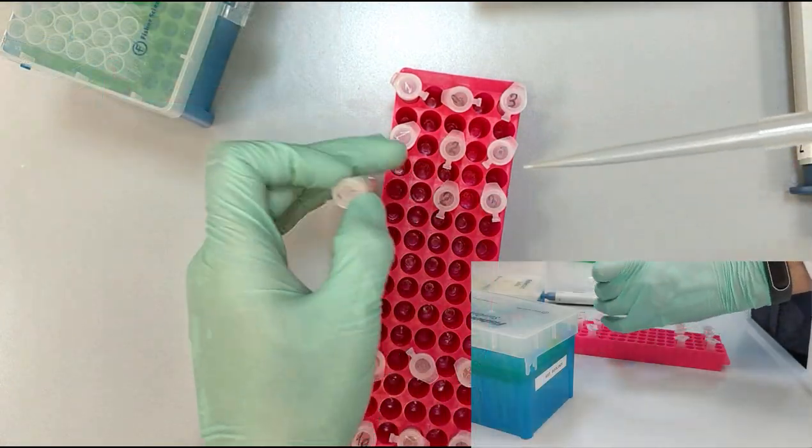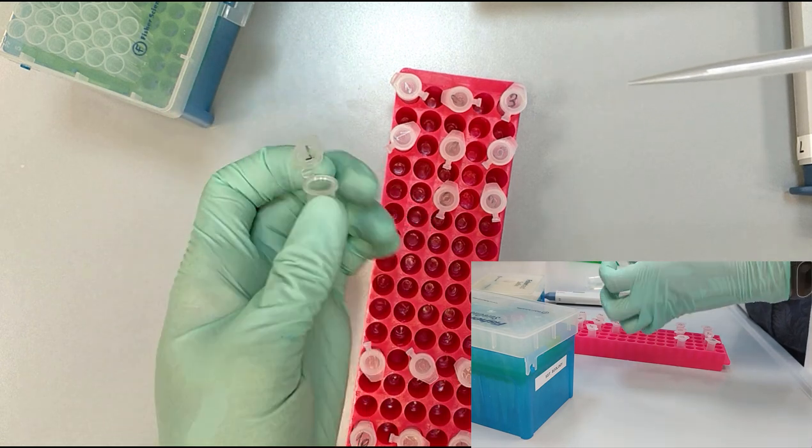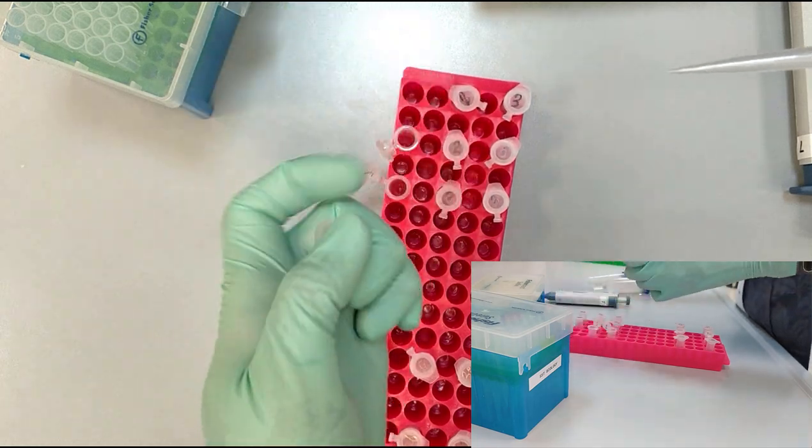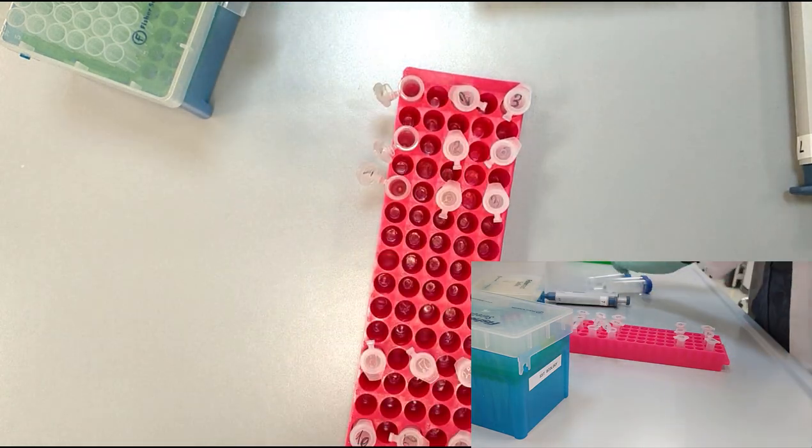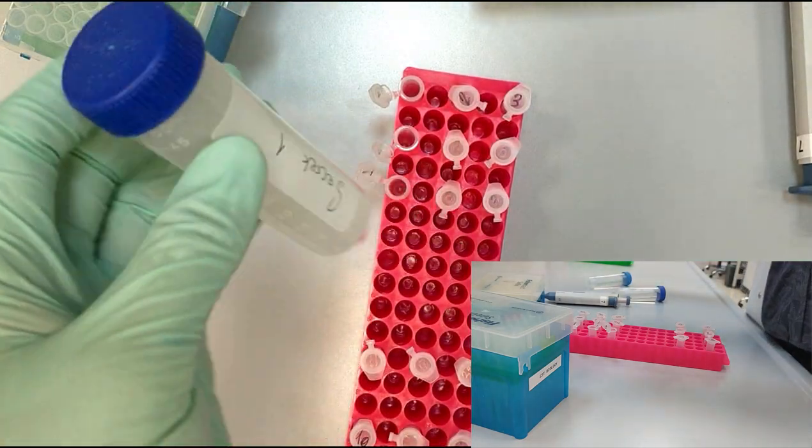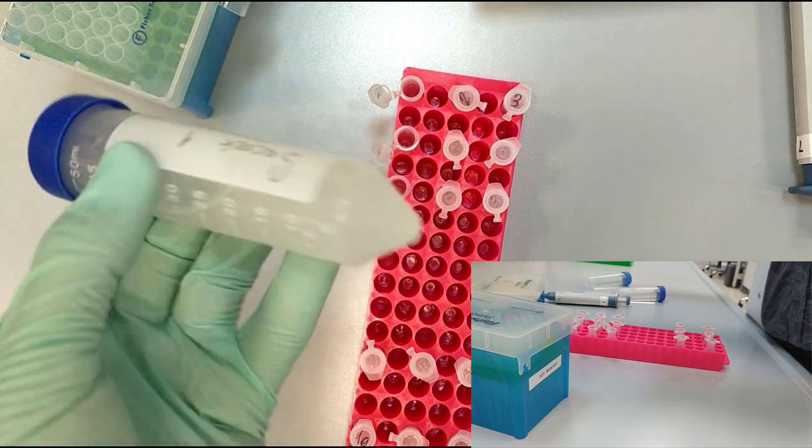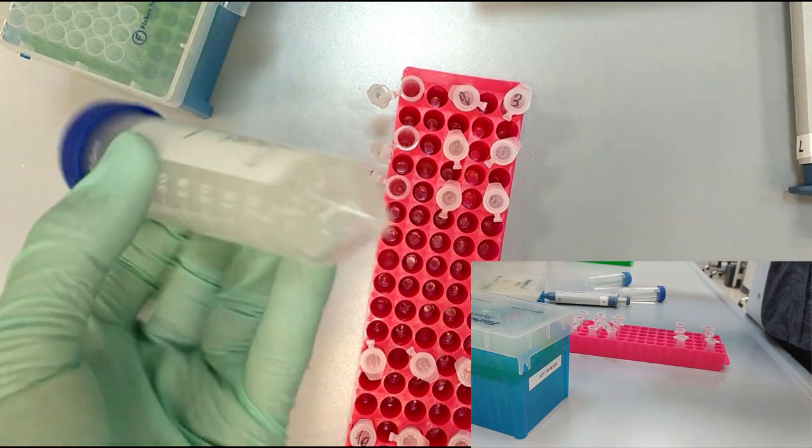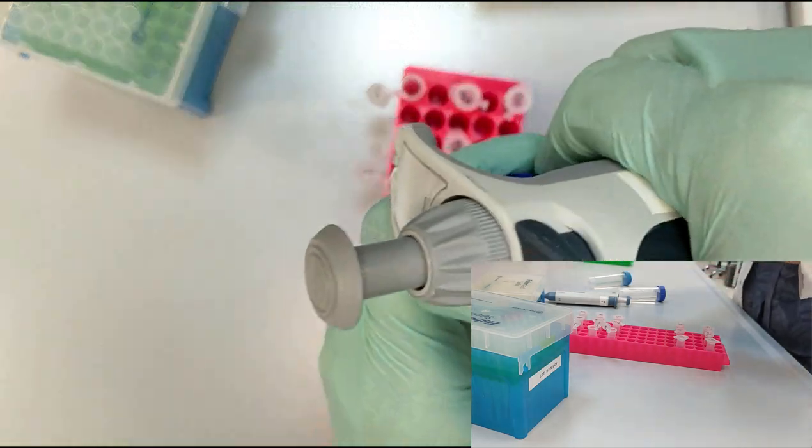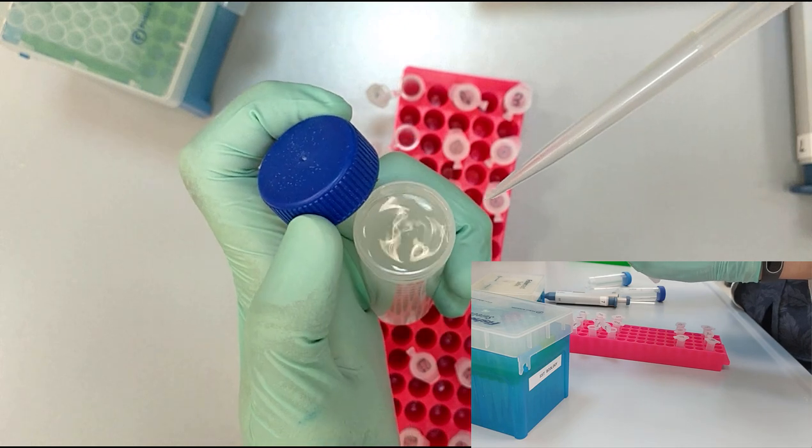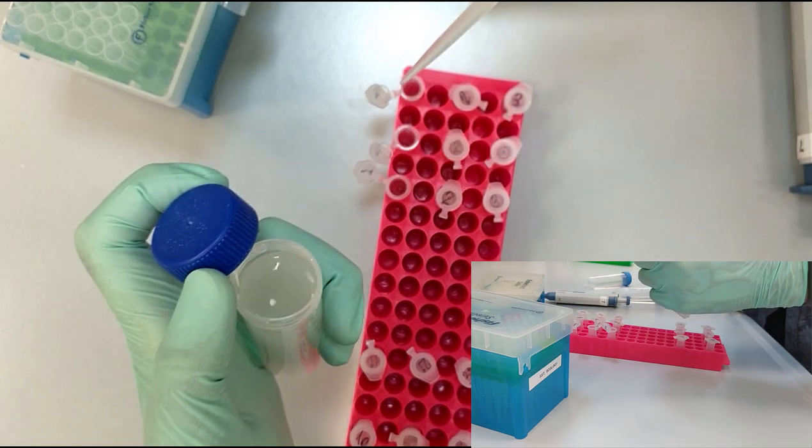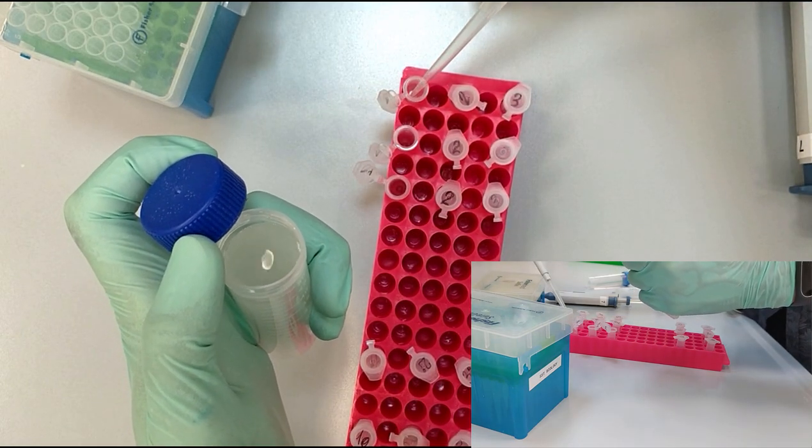So what is next? We will be opening each of the corresponding lids to make it in one go. Before we start, we mix it again. After mixing, we open the falcon tube, take one milliliter and transfer it to each of the eppendorf tubes.